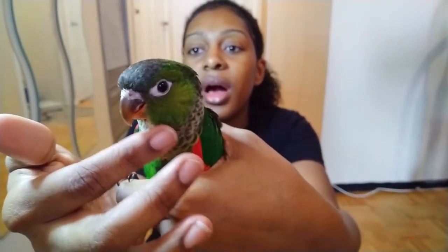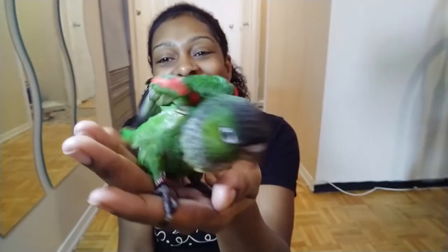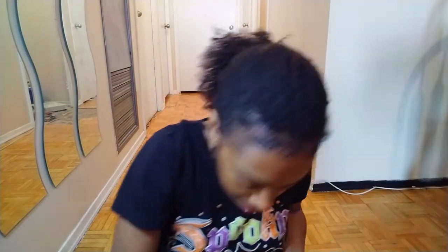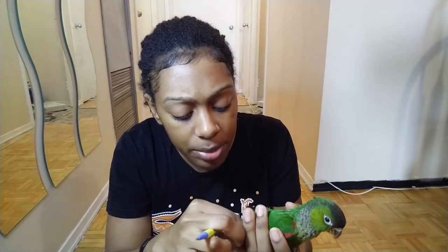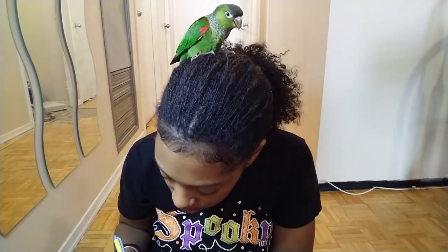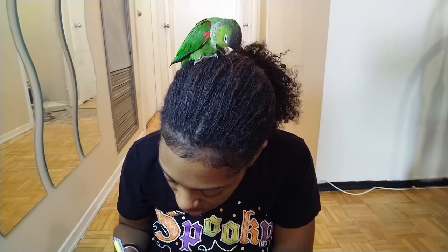So that's the quick stop I put on if I clip any other nails too short. Here's baby — baby loves to fly. I gave baby some chili peppers, so that's why baby's mouth is red. So we're going to clip baby's nails, which is nothing new. Before I do that, let me just get down baby's ID. I'm going to put 2211. Species is a rock conure, black cap conure — I'm just going to put rock conure. Owner so far is me.